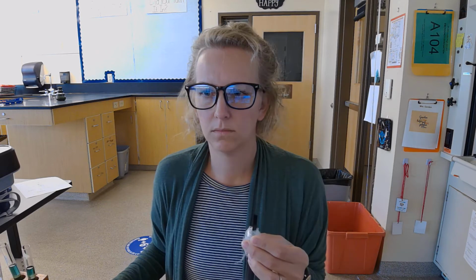Then we're going to see the color change after vigorous exercise. So I will do 2 minutes of vigorous exercise, probably jumping jacks, and then I will come back and blow into the solution again, and we will time the solution each time. So each time we come back and breathe into the tube, we'll use a timer to see how long it takes. So I'm going to get set up. I'm going to pause the video, and then we're going to run our first trial.